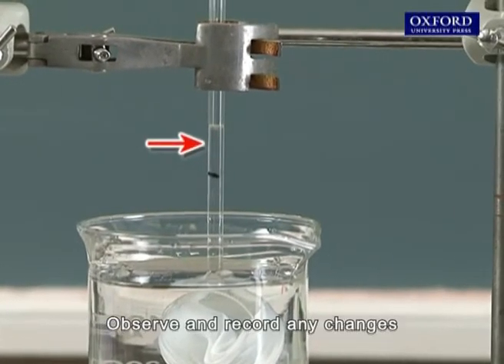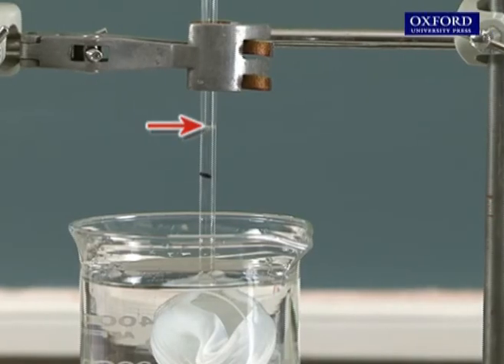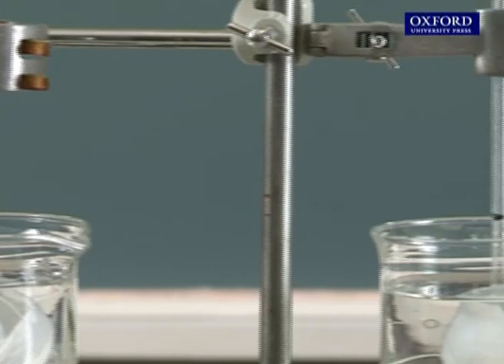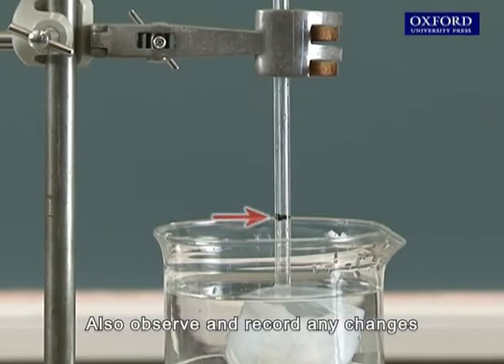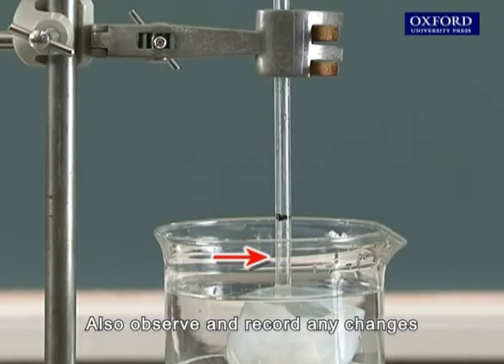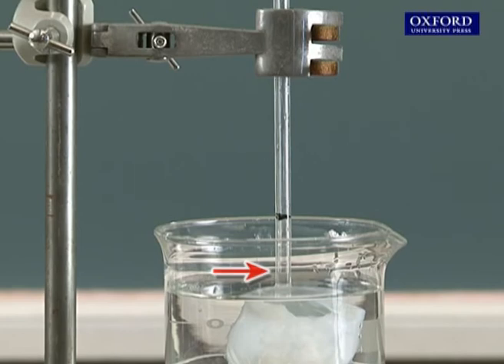Observe and record any changes in the liquid level in setup A. Also observe and record any changes in liquid level in setup B.